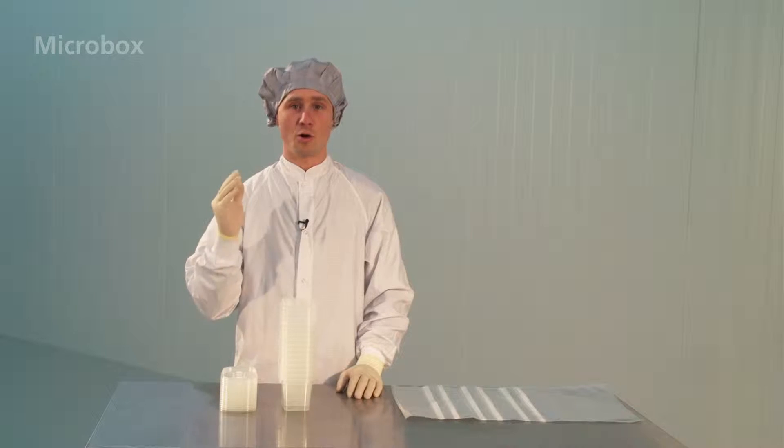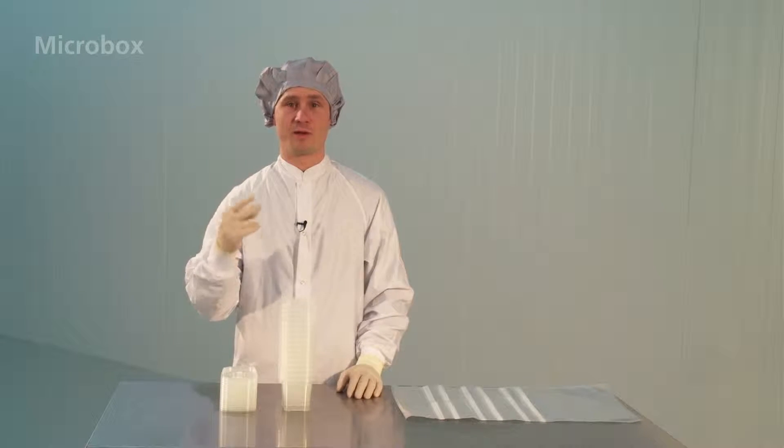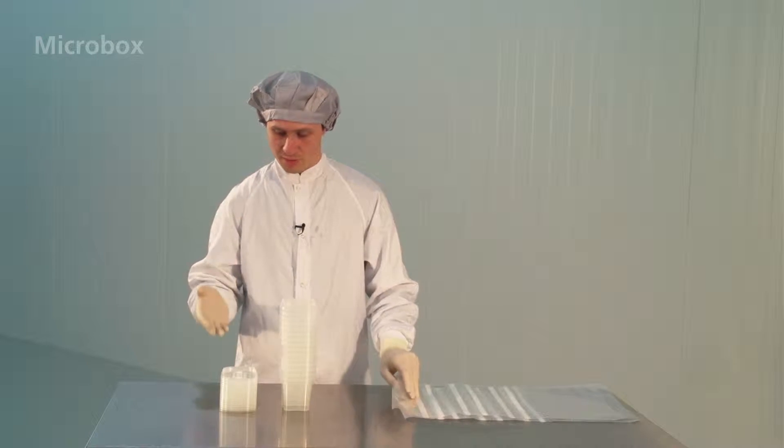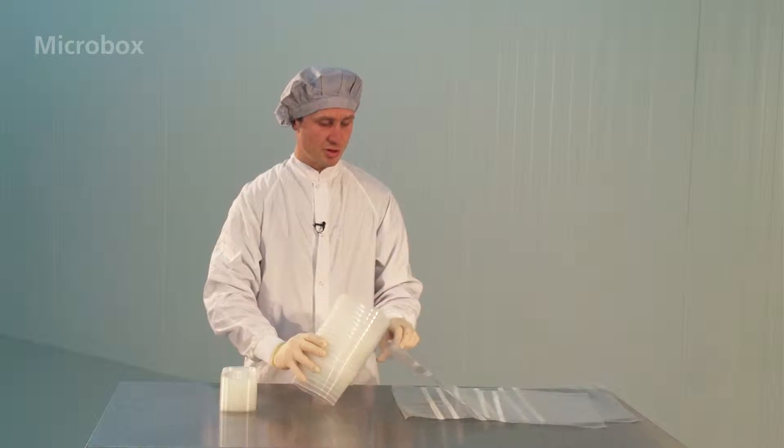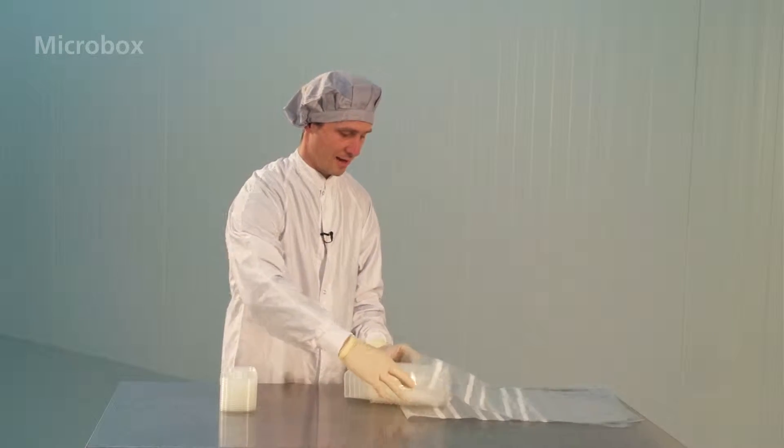For using autoclaveable micro boxes, there are two different methods. The first one: wrap boxes and lids separately in an autoclaveable plastic bag, for example a breathing bag.